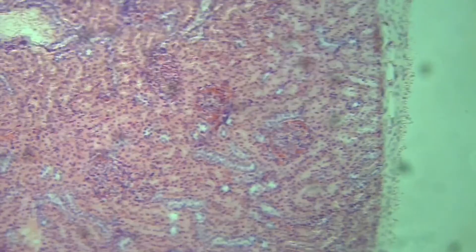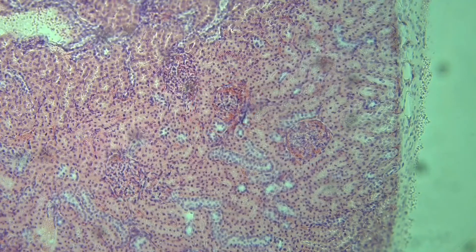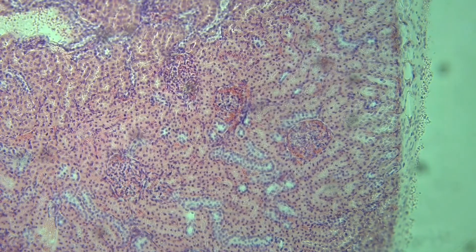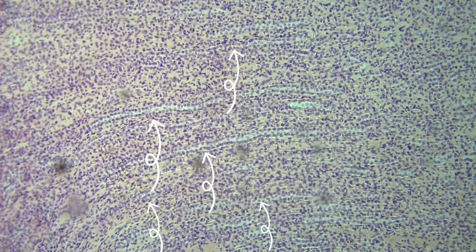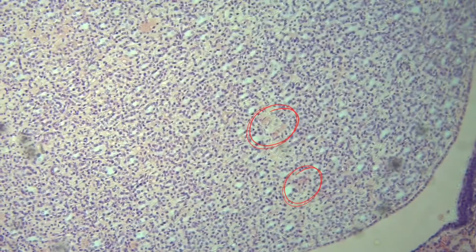At high magnification of the microscope, in the cortex are visible renal corpuscles, convoluted tubules, and blood vessels. In the medulla are visible straight tubules and blood vessels.